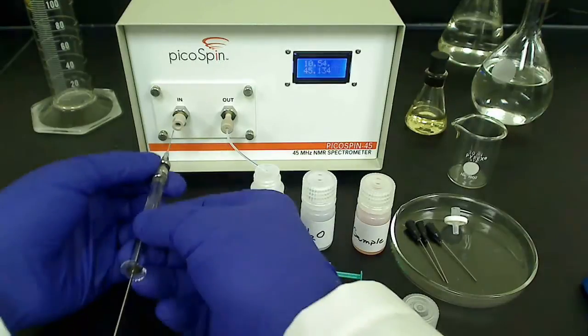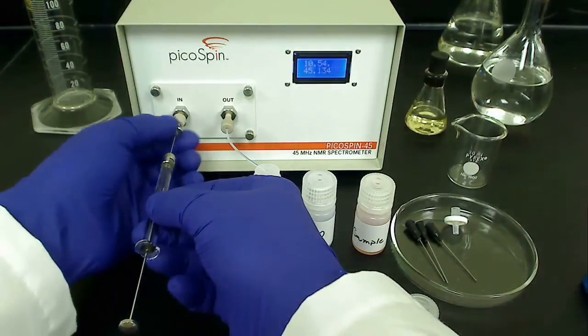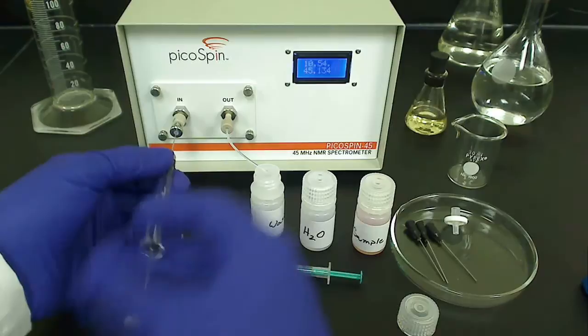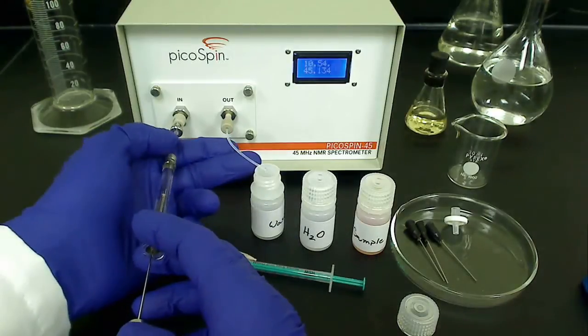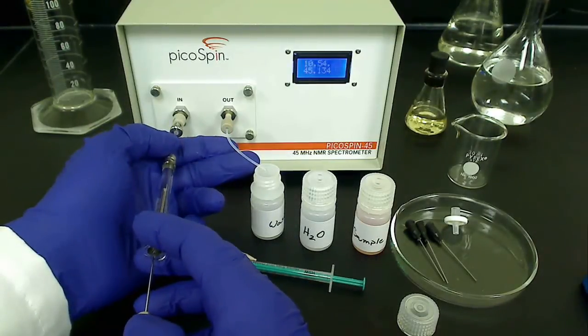This amounts to approximately 3 to 4 droplets being formed at the exit of the drain tube. You can inject as much sample as you like, so long as at least 3 to 4 droplets have been formed.